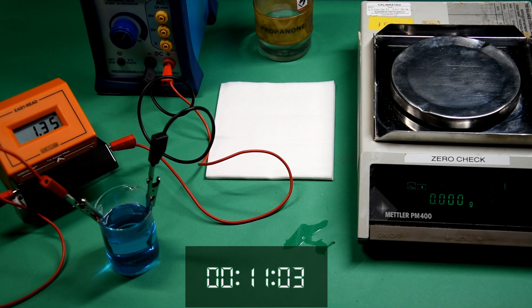And now we're back to normal speed. This experiment probably should have been run for 10 minutes exactly, but I just ran it until the changes at the electrodes were obvious.